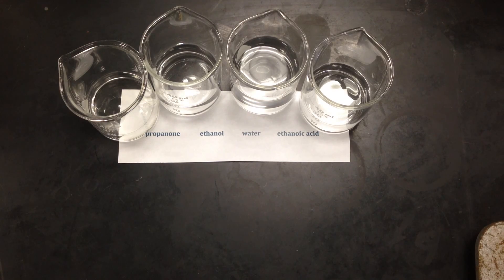This is largely due to their intermolecular attractions, the attractions they have for one another. So we're going to view how these four liquids evaporate, or how fast they evaporate, and that's going to give us a clue on how well they stick together, what kind of intermolecular attractions they have, what kind of boiling points they have, and what kind of vapor pressure.